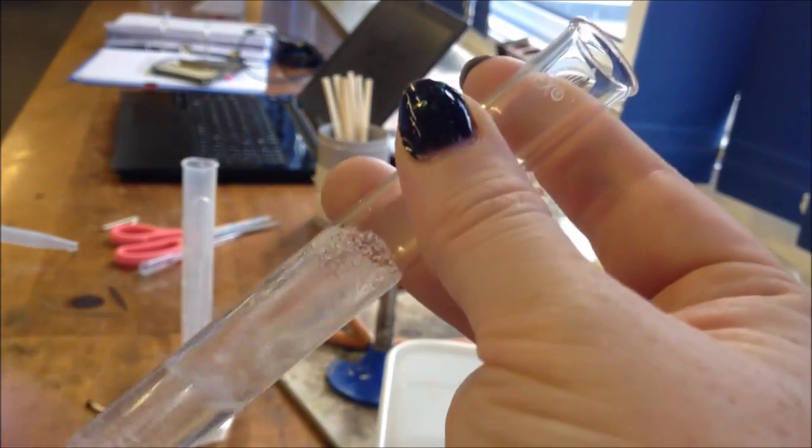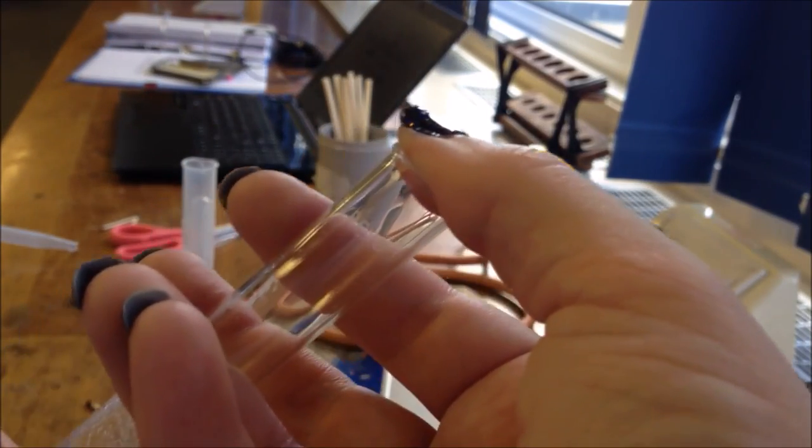But you've got a very secure grip on the top and the top doesn't actually move very much. If you try and do this you're mixing the top but not mixing the bottom.